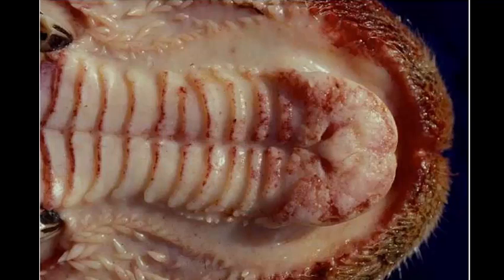Okay, time's up. We're looking at the dental pad and the hard palate. So we're looking up into the maxilla of the sheep. The morphologic diagnosis is multifocal to coalescing ulcerative stomatitis, cheilitis, and palatitis. If you didn't break out stomatitis and palatitis, you just said stomatitis, that's fine.